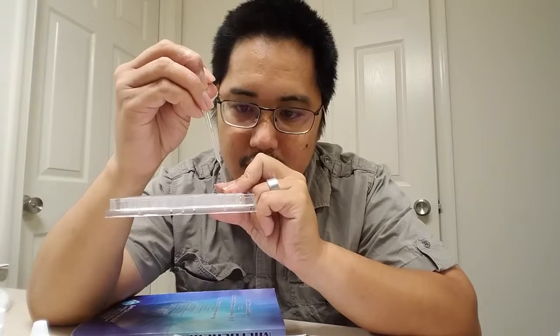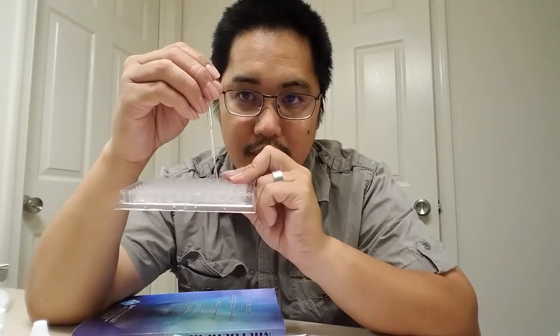1. Oh, I didn't grab 2 of them. Okay. And 2. And I'm going to put the excess back in well A1. I'm just going to squeeze it all in there. There we go. All right, now I'm going to mix up well A2, and I'll show you how I'm going to do it. I'm going to suck up some of the liquid and put it back in. Suck up some liquid, put it back in. Do it one more time. There we go.